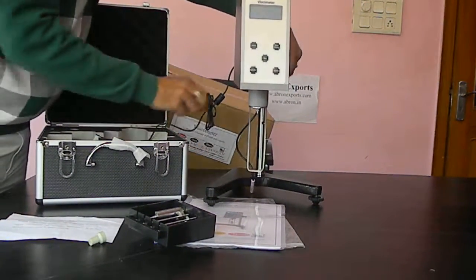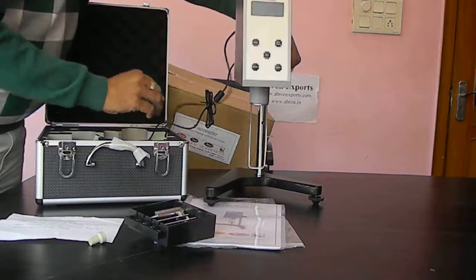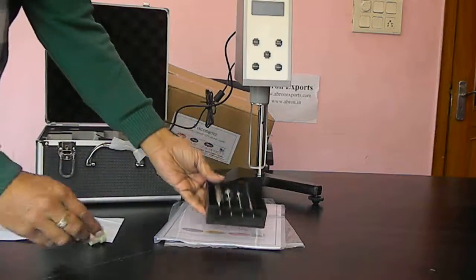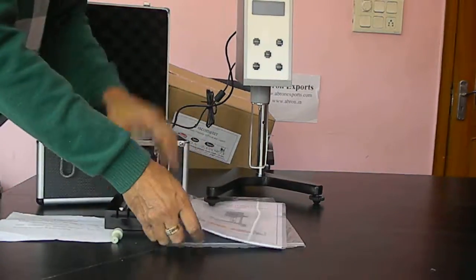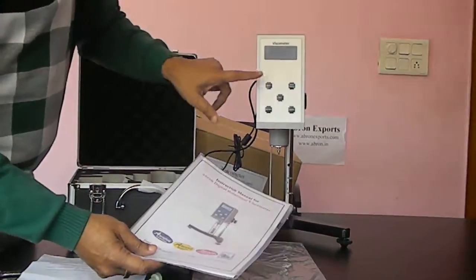Connected to the power supply. And these are accessories. You can do these experiments and digitally control.